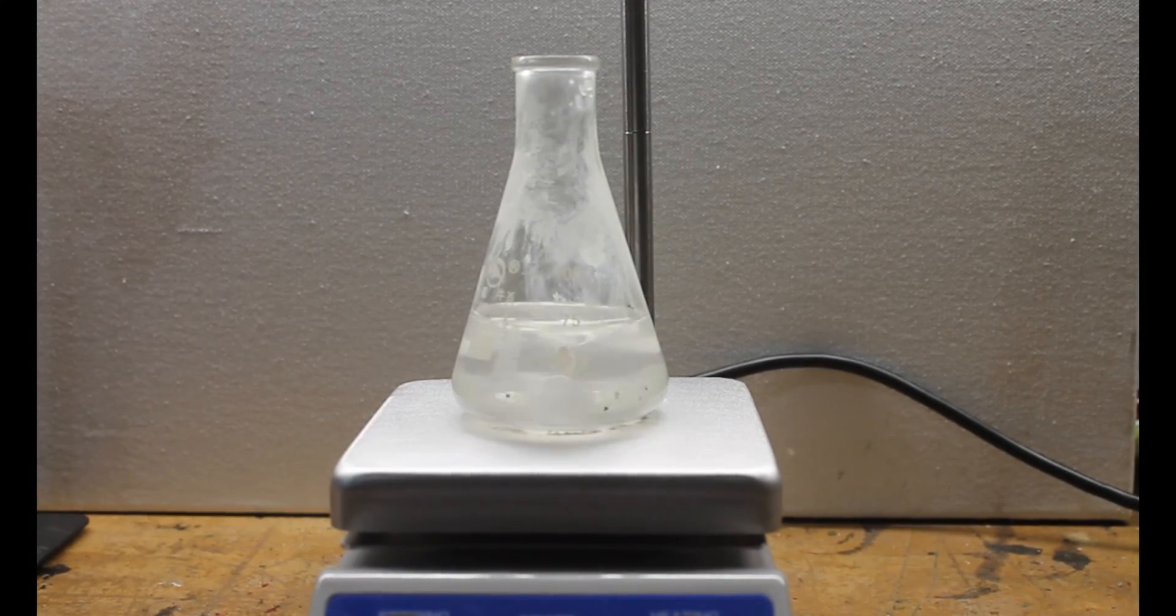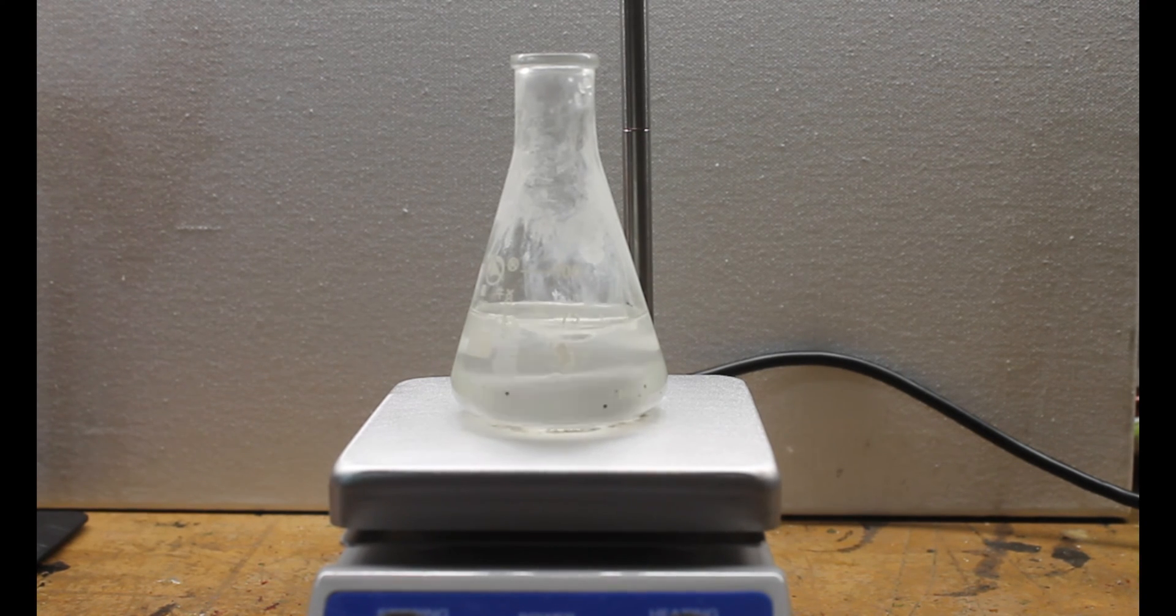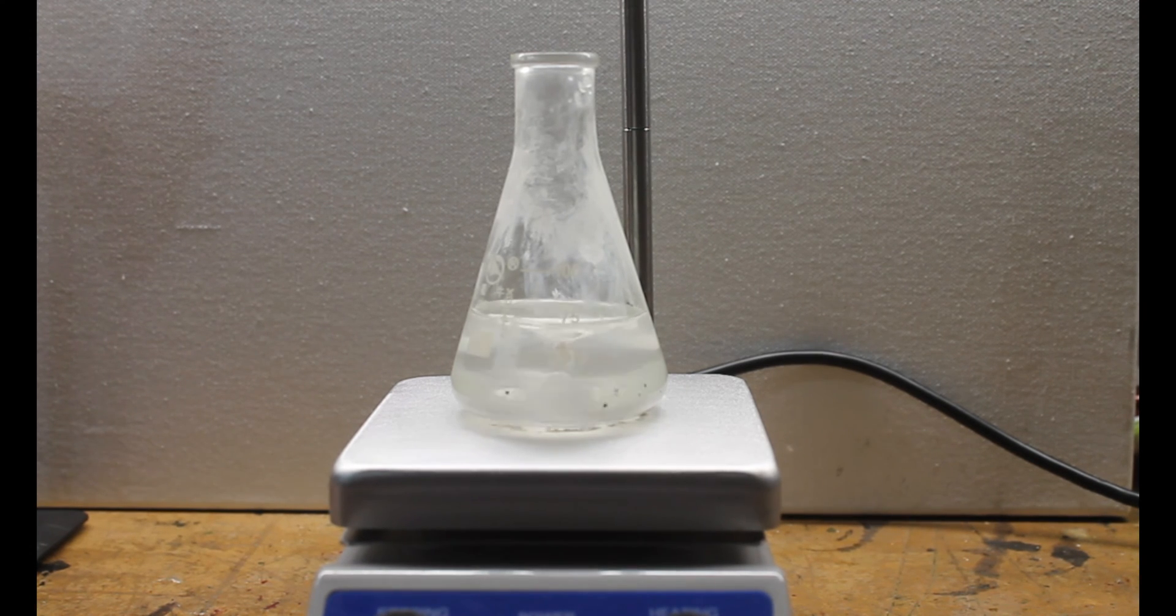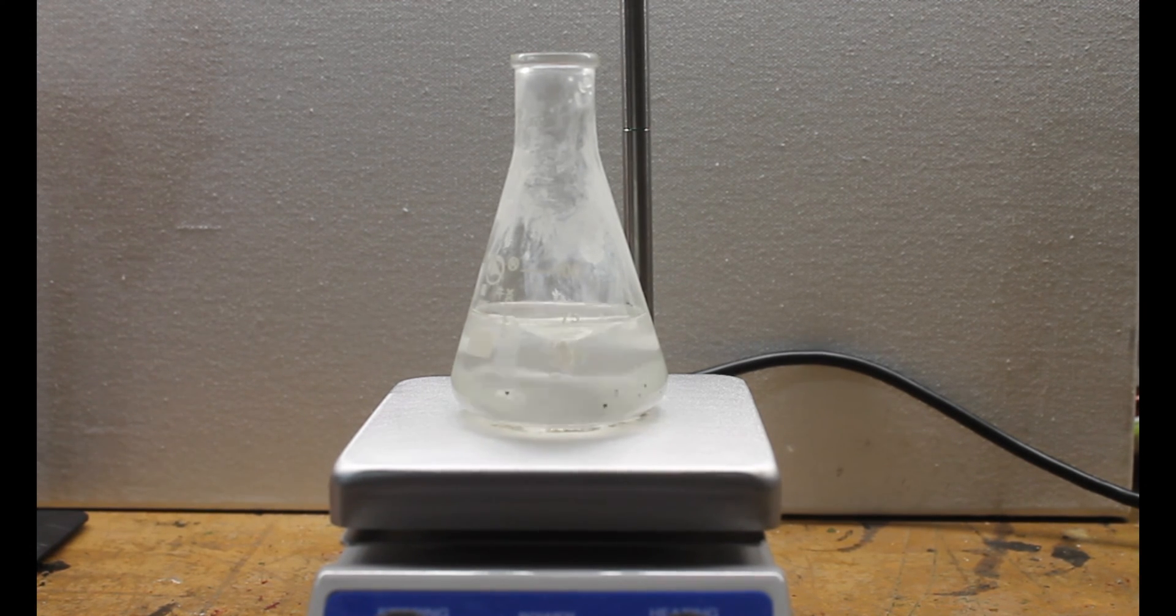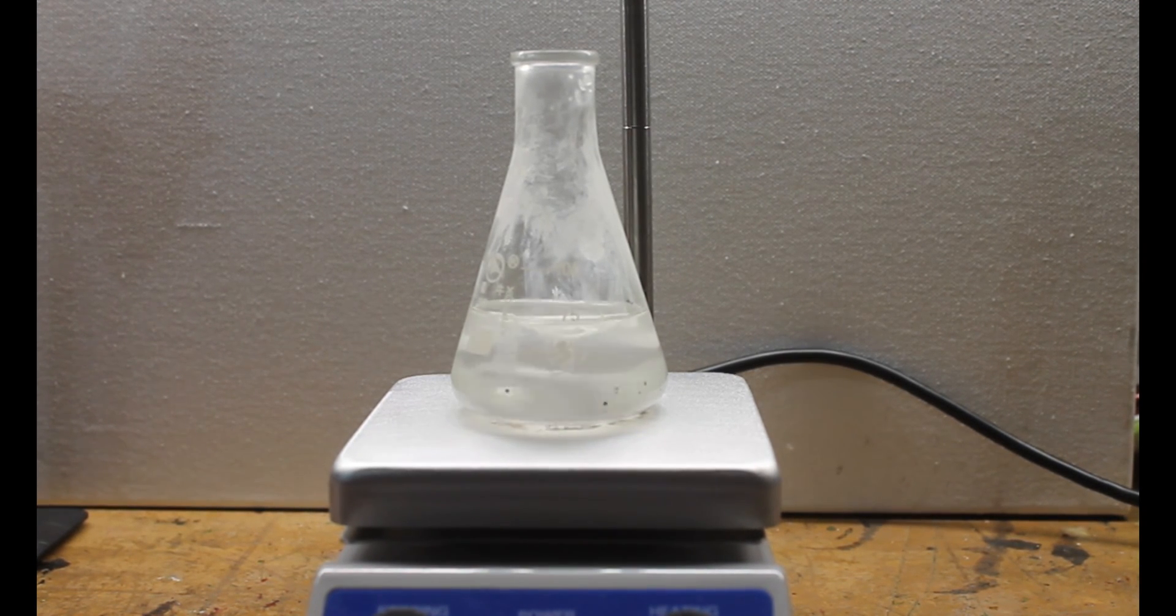After the solution had been left stirring for a while, it became far more clear as more and more of the sodium hydroxide had dissolved. But the temperature had continued to increase and I actually became relatively concerned about our flask as this was not borosilicate glass.